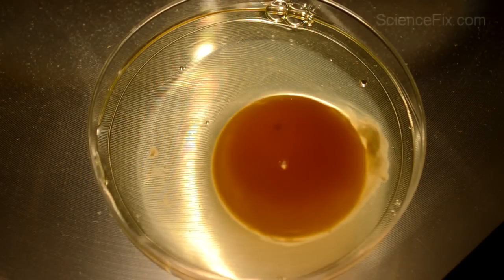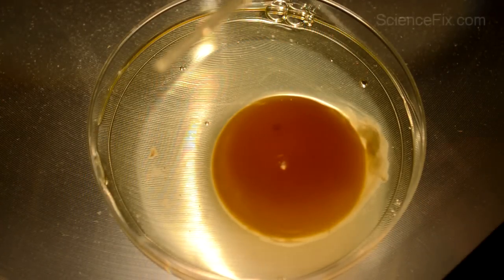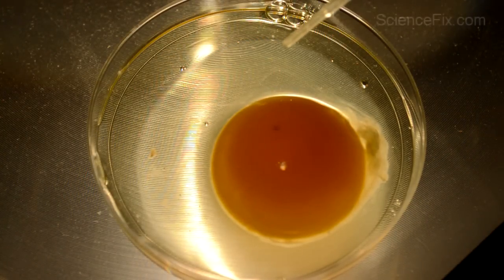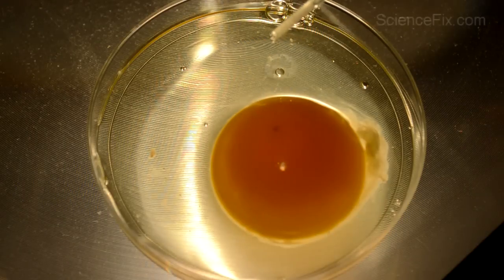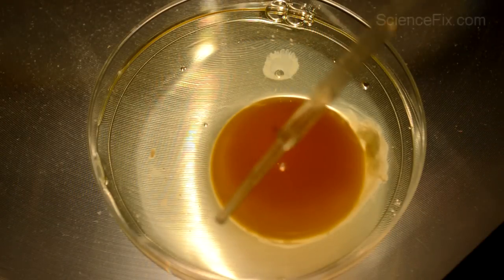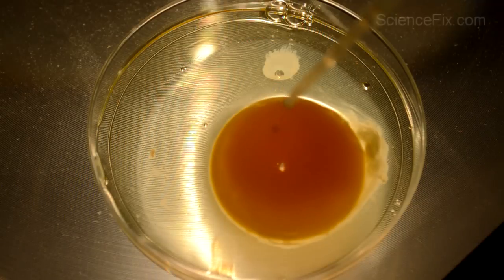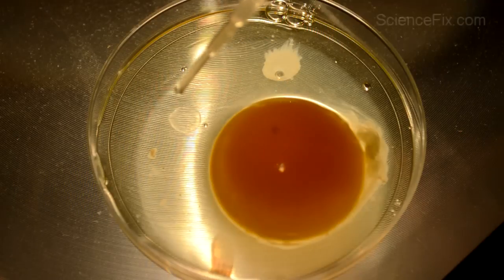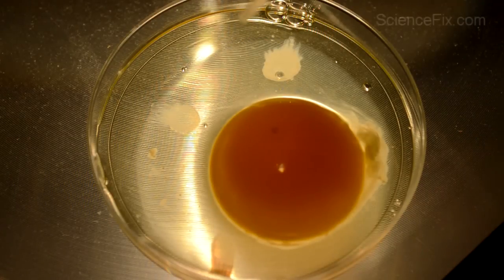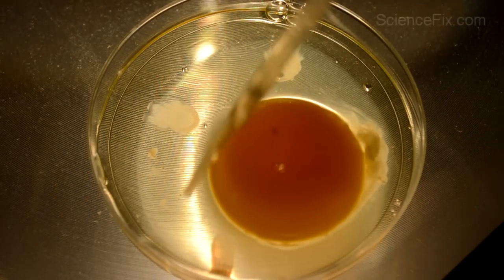Drops of hydrochloric acid are then placed onto the egg white, and let's see what happens. Hydrochloric acid reacts with the egg white so that the egg white is not so transparent anymore. It's more translucent, not as much light is passing through that egg white.